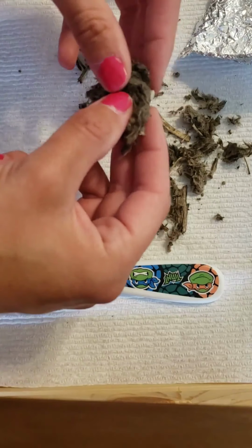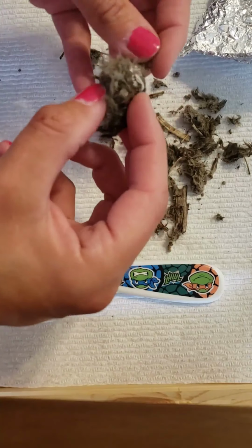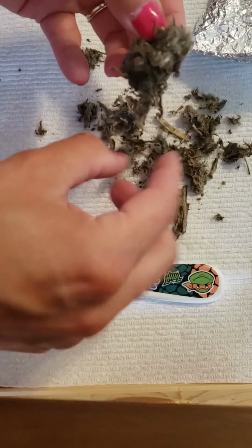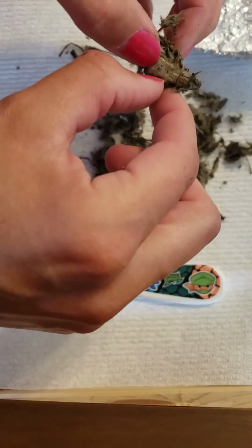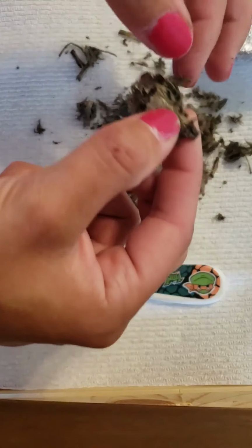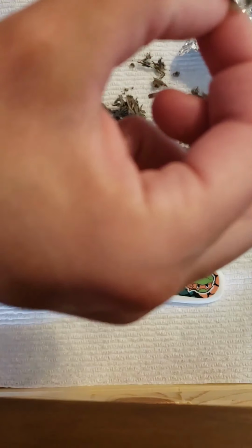Oh my goodness. I think I found one. Hold on. Oh my goodness. This one is crazy. Oh, I hope I don't break it. Because, oh no, this is crazy. Did you break it? No, I didn't break it. I found one. Okay, hold on. See? Yeah, you did. This is so bizarre.